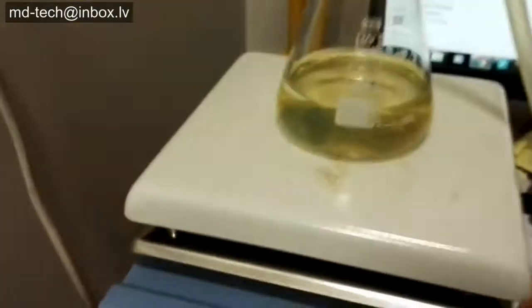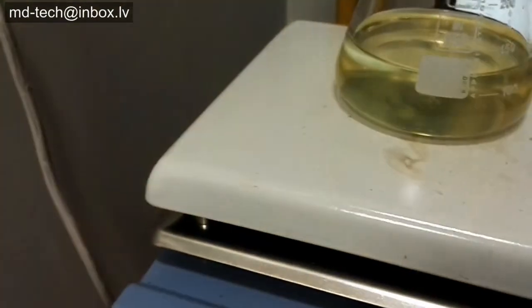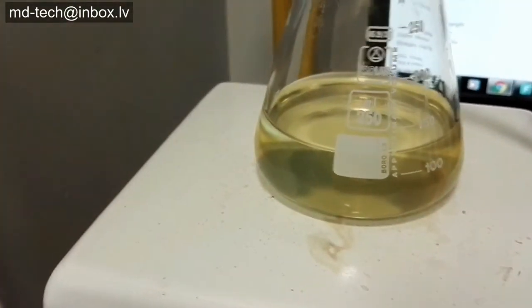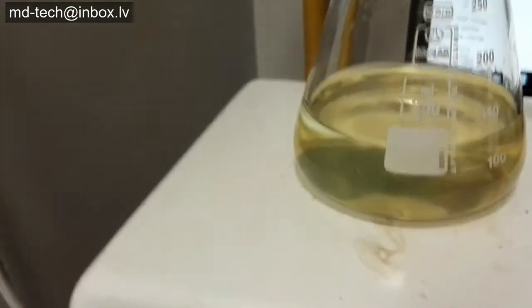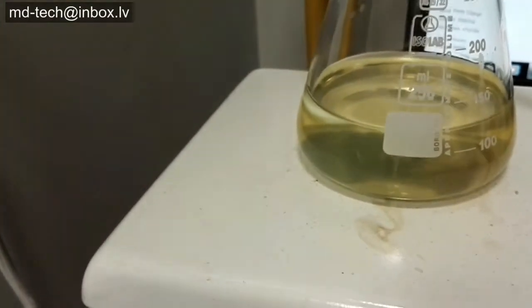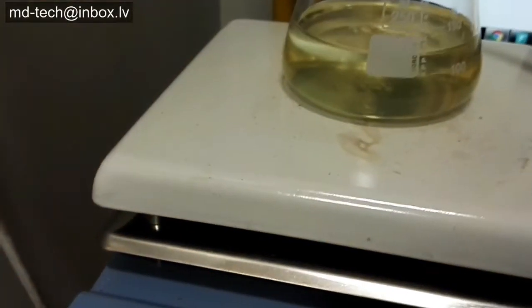Temperature is 100 degrees Celsius and all hydroxide is dissolved. Solution turns clear. At this point you need to add a small amount of 30% hydrogen peroxide, no more than 1 milliliter to 1 liter. Very small amount.